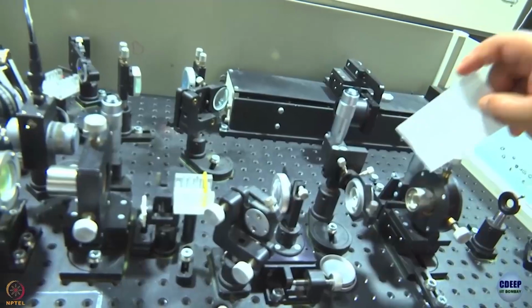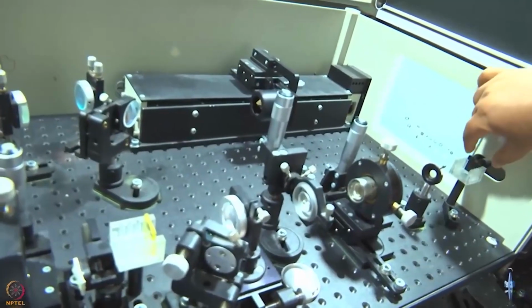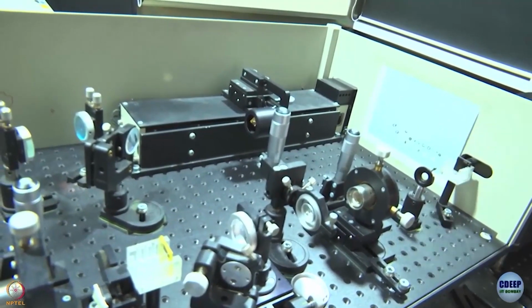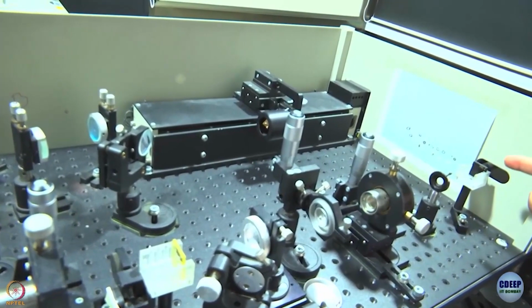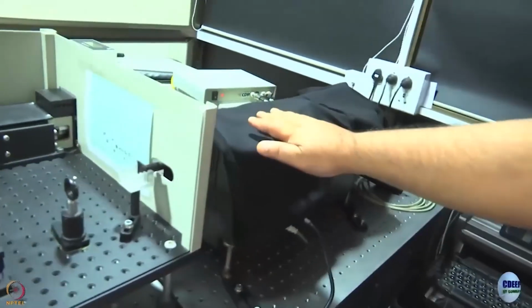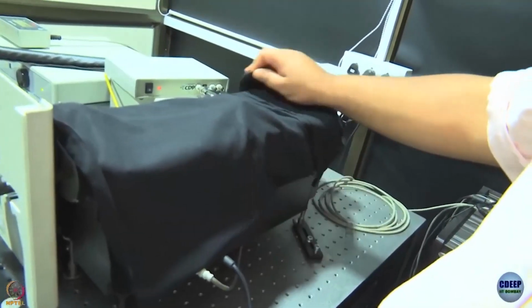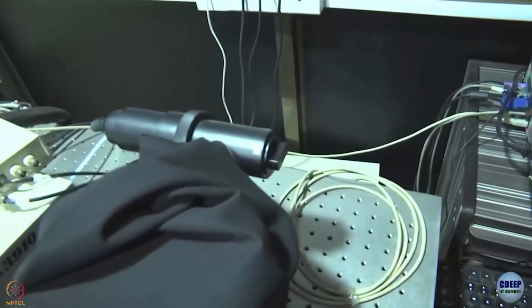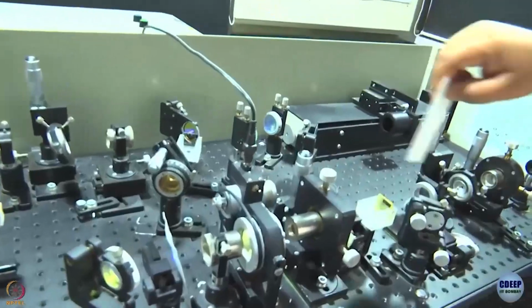This lens is L5, goes straight. You see this is opened all the way. This piece of optic here is a short pass filter. It allows UV light to go through, but not visible light. So, you understand this is the path of the sum frequency as well, as we will show you. This here is the monochromator. As I told you, this is an old machine, so it has developed some light leak. So, you have covered it with black cloth, and this is what contains the photomultiplier detector. So, what we have shown you now is the path of the gate light.